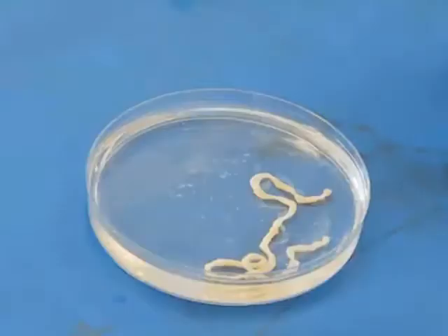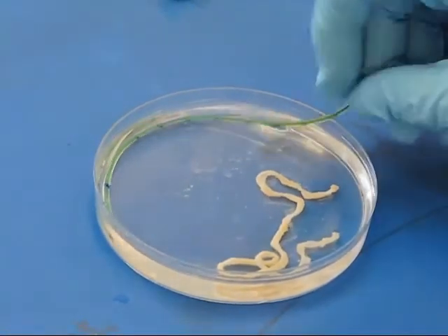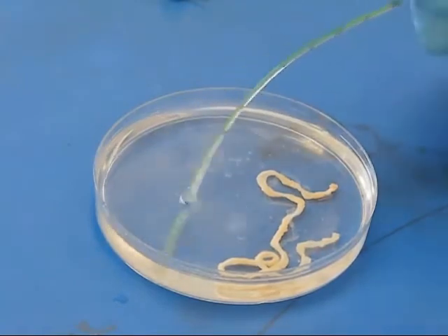A segment of mouse intestine will be provided. The most challenging task for you today will be the process of everting the segment or turning it inside out.